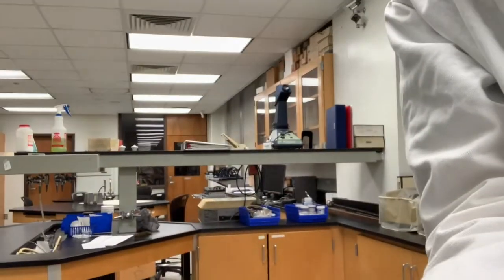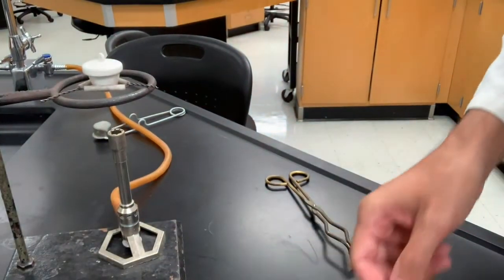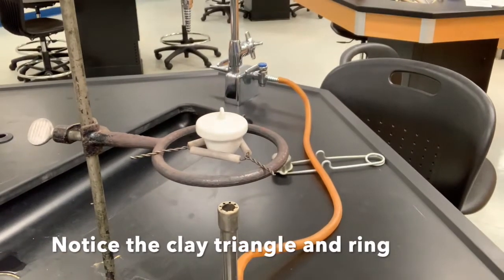The water that's in this crystal is actually part of the compound, the copper sulfate hydrate, but when the water comes out it goes away as steam and into the atmosphere, and so it decreases in mass. And I'll position the camera right here for the duration.